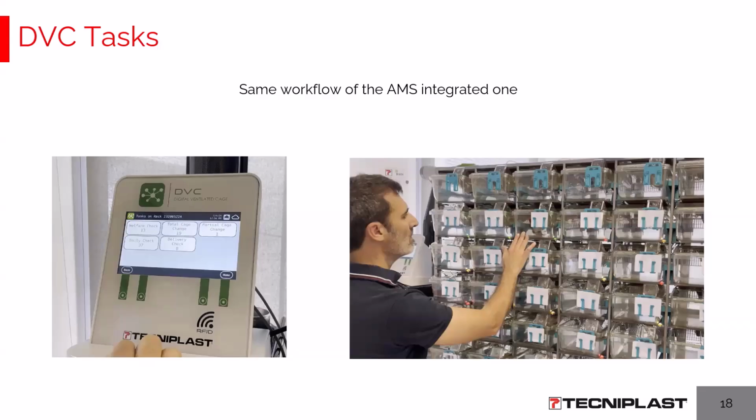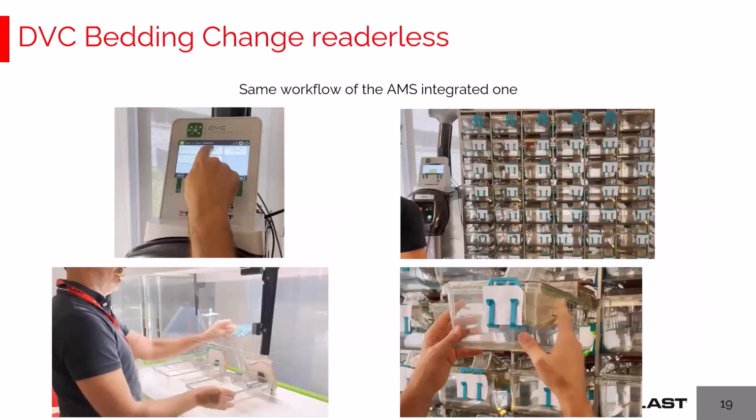So regarding running the DVC tasks, daily, welfare, there is no big difference compared to the situation where the DVC was integrated with AMS. The same for the bedding change. Also in this case, could be exactly the same workflow. These are DVC tasks. They don't depend upon the AMS system, the animal management system, sorry. So basically, the DVC manages by itself these tasks that, again, in our preferred version can be run and achieved through the DVC master interface. Again, our preferred way is the readerless. In case you don't have to provide any feedback, and we will cover this topic later, the readerless procedure is extremely fast and straightforward.